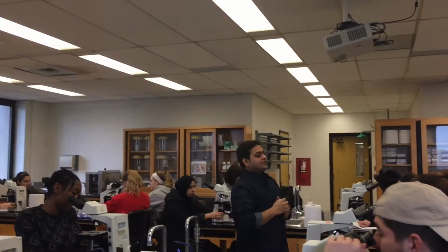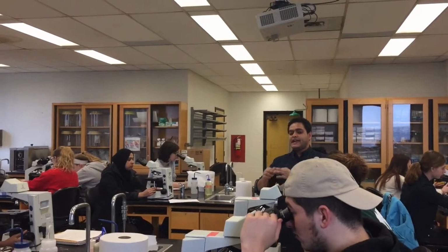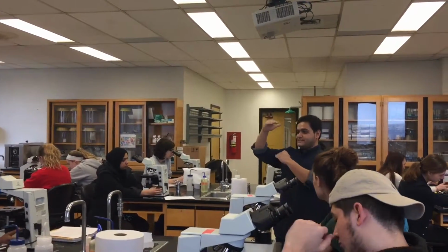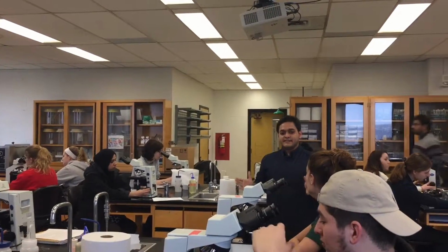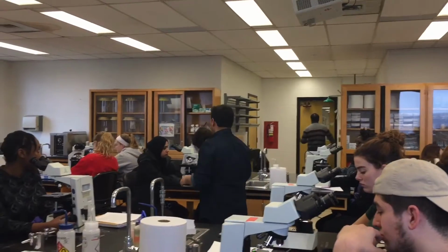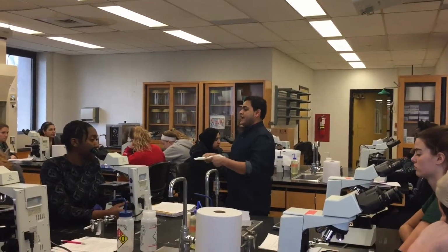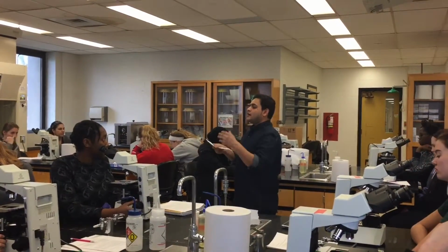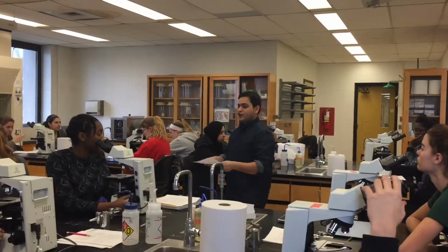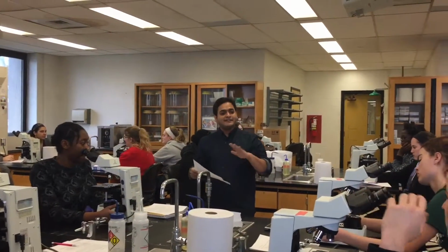Okay? So the reason we need to use those knobs is we need to look at a slide at a certain specific focus. We'll bring the objective lens down to the slide so that we can see the image clearly. Did that make sense? So that's what you're doing. For example, you use the big knob to try to find things, and suddenly something appears, but it appears blurry. It is not very clear. Then you use the outer knob, the smaller one, to find focus. So the image should look very clear and crisp.